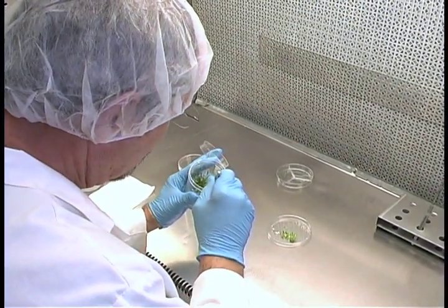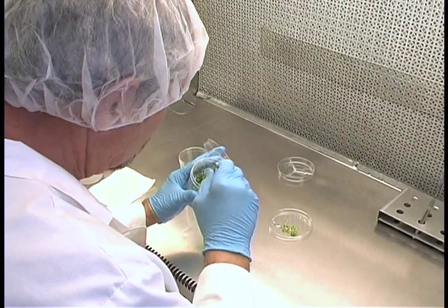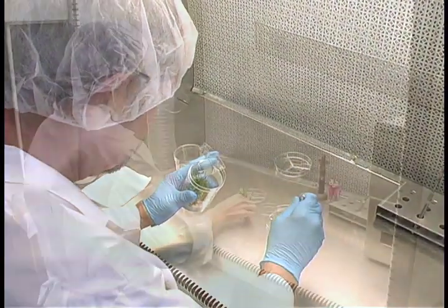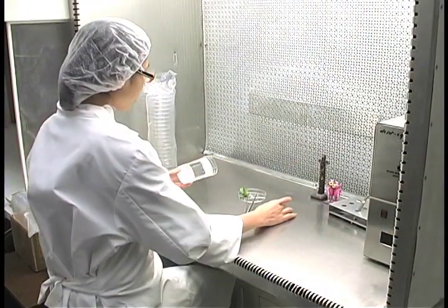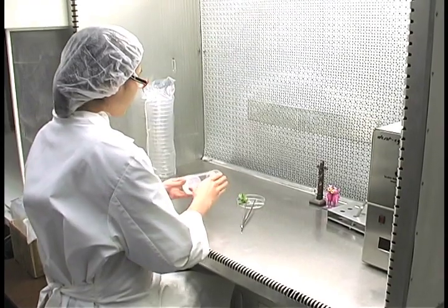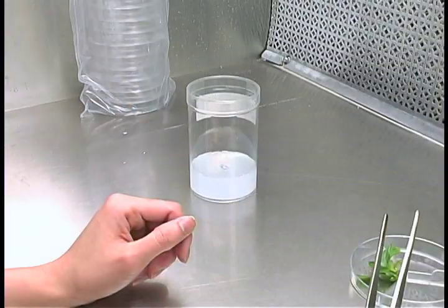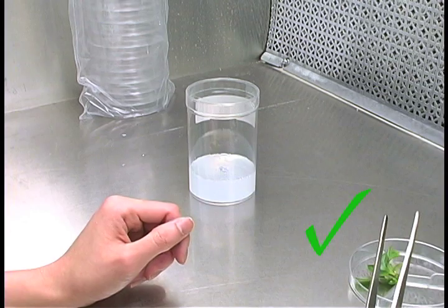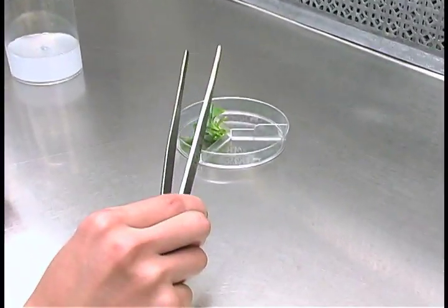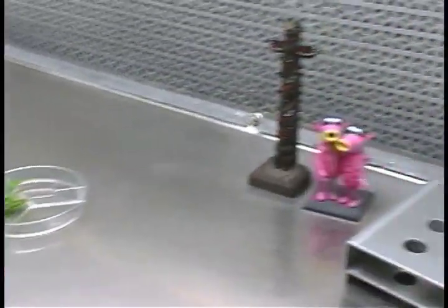Work quickly, though. The longer it takes to manipulate the tissues, the greater the chance of contamination. Have only the necessary items in the sterile work area and remove items that are no longer needed as quickly as possible. Think about each step before beginning so that you understand what you are about to do.